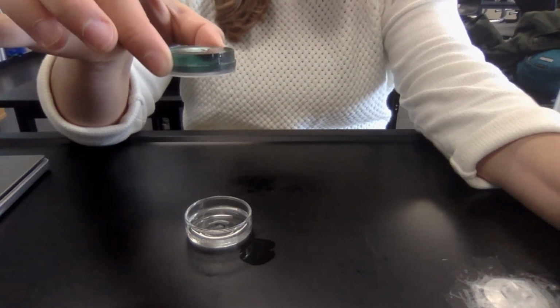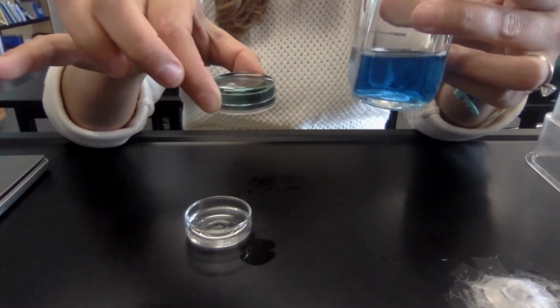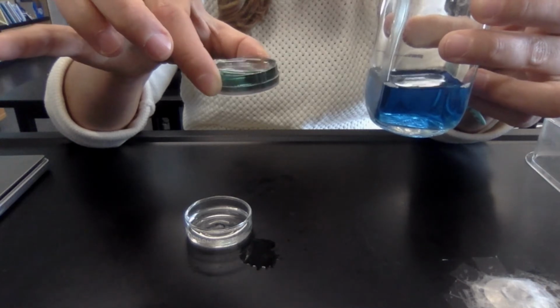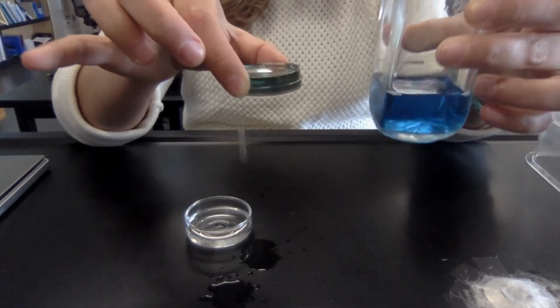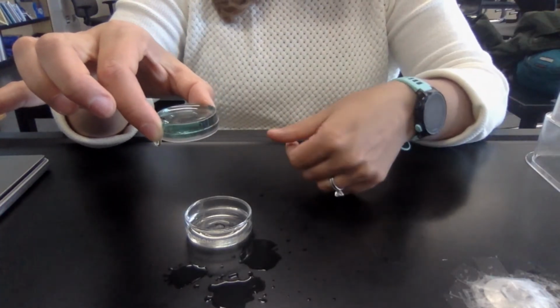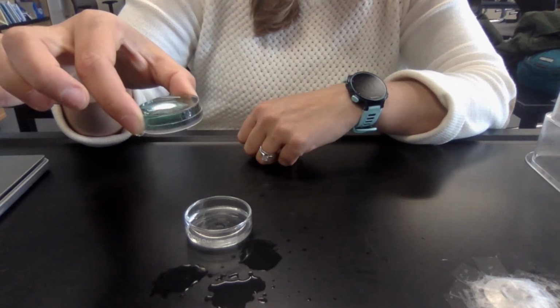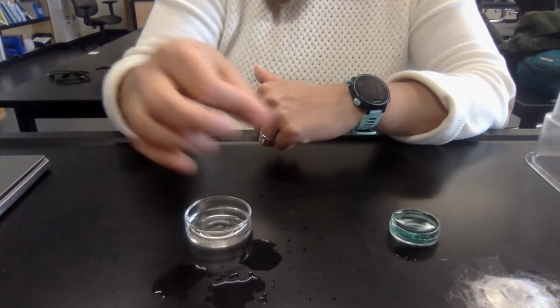However, it's kind of hard to tell based on this video. So here's the original blue, and then here is the color that it is now, and it looks like it's definitely changed towards sort of that yellowy green color. And I am spilling it on myself because I filled this container a little bit too high, but that's totally fine. BTB is safe to touch.